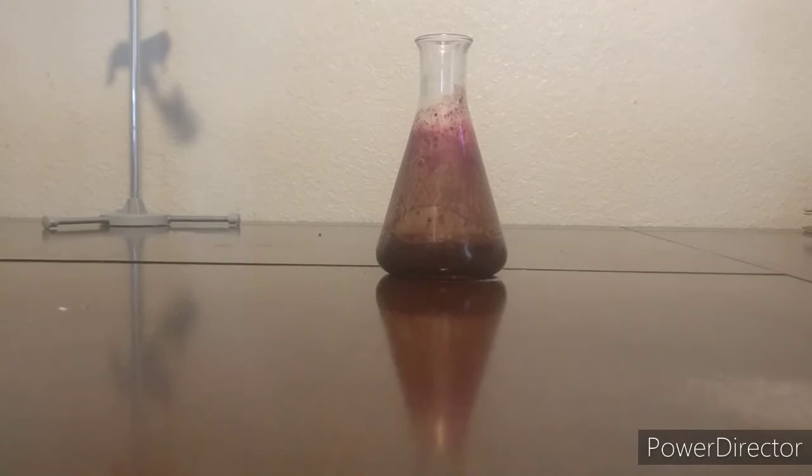Now, to deal with the waste, I added one teaspoon of sodium carbonate. When I mix the substance, you can actually hear some bubbling and fizzing as it reacts. Now, we are left with a dark brown solution that you can just dispose of.